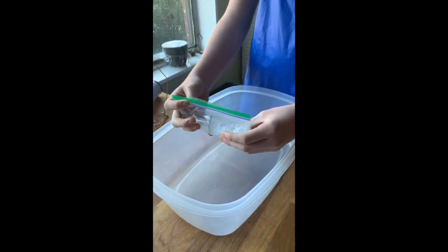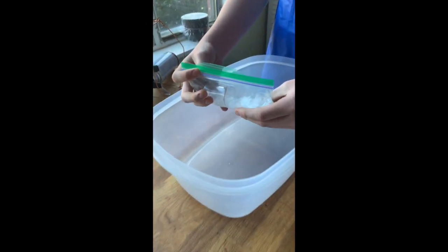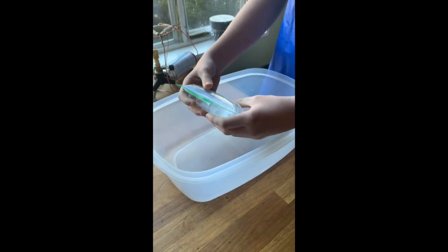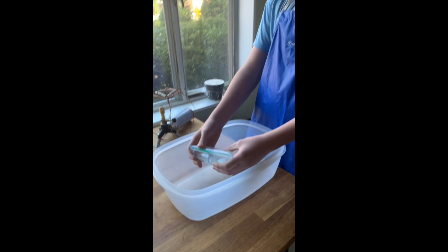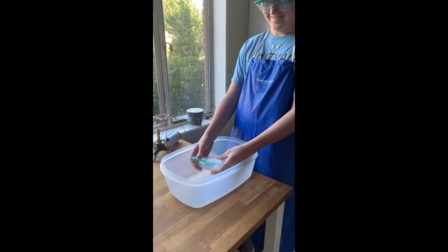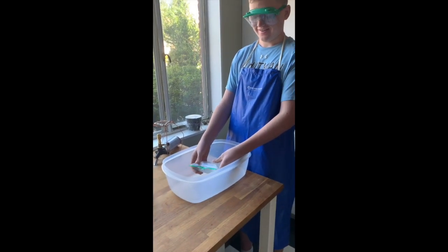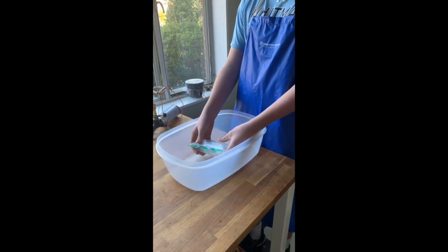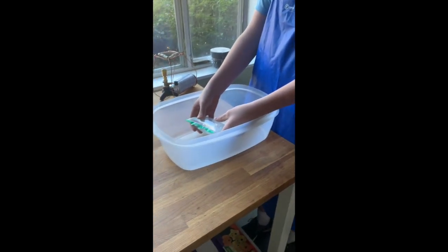Okay, tell me what the bag feels like, Maurice. It's getting warmer. What else is happening to the bag? It's expanding. Yep. I'm standing back. Maurice has goggles on. Be ready, it could pop. It's getting very warm and getting very full.